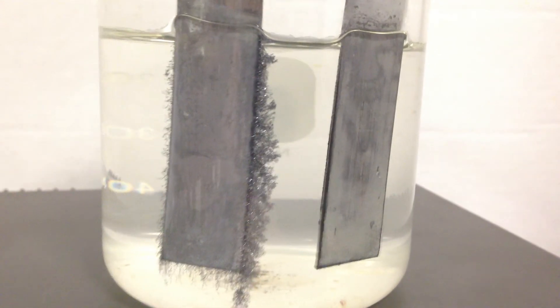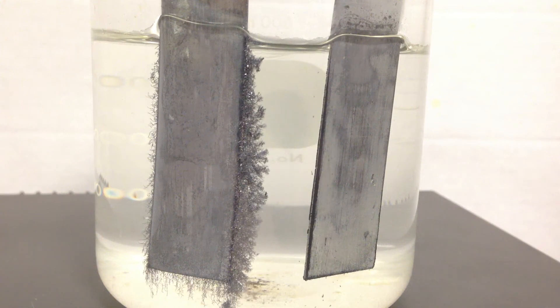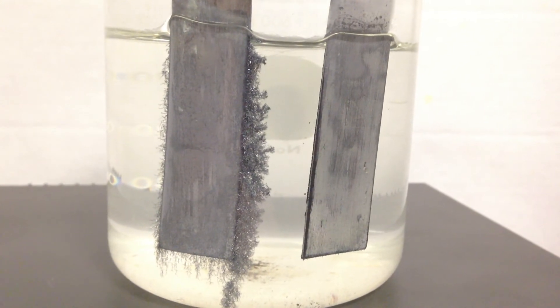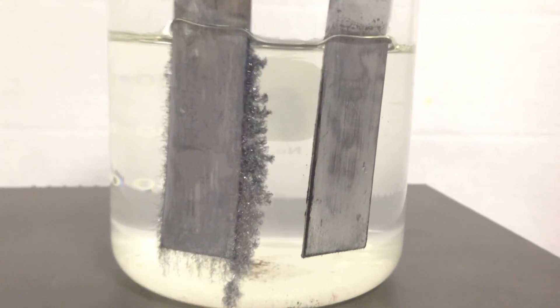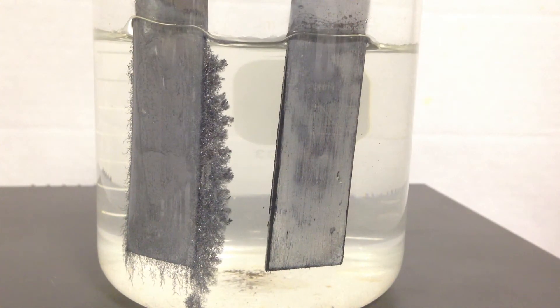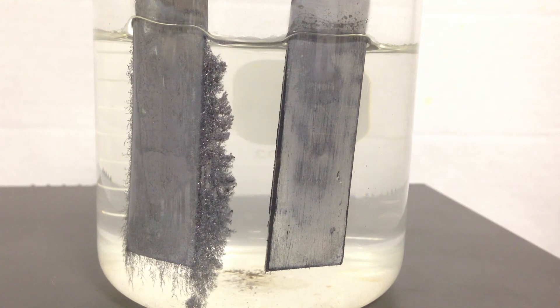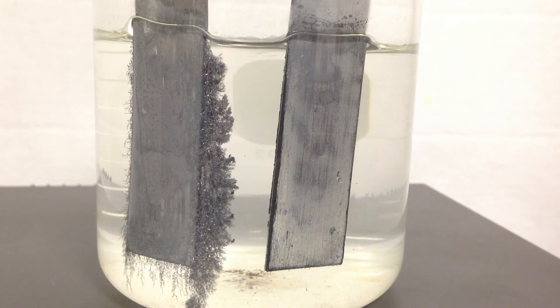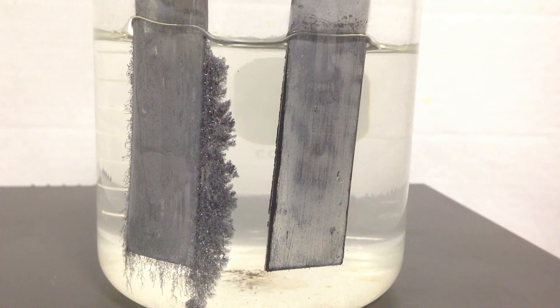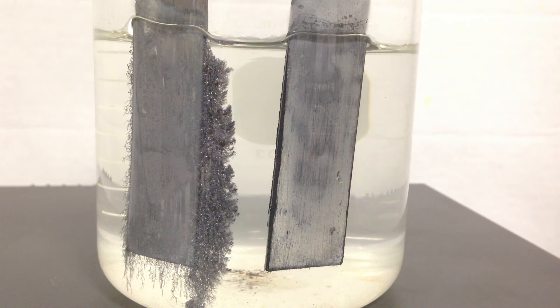On the other side, you can see that electrode getting smaller, with some pitting occurring if you look carefully. There's your electroplating. Of course, in industry we would never plate in an aqueous environment because you get a mossy type of metal deposit, but this is a great demonstration.